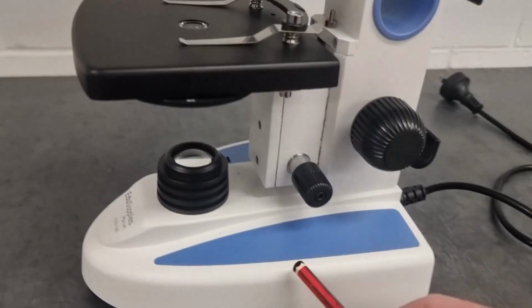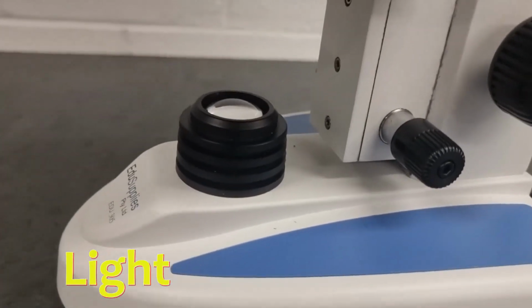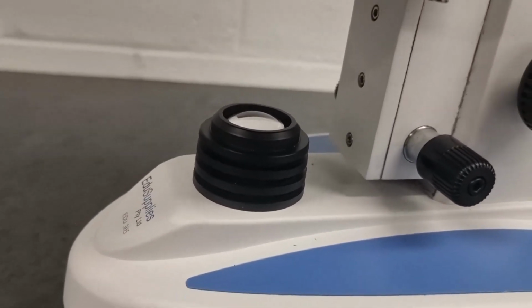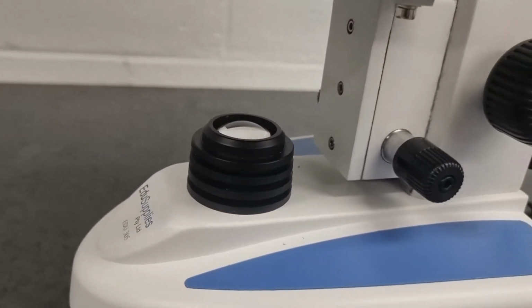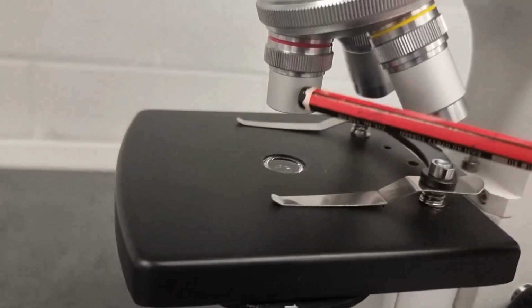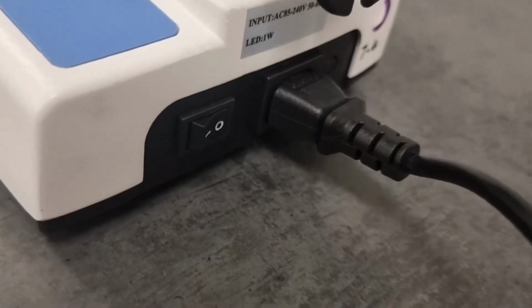So down near the base of the microscope here, the first thing we might notice is this right here. That's because these days we have technology, and what we do is we plug our microscopes in, we turn them on, and that is our light source. Now back in the day, instead of an electronic light source like this, we had a mirror, and we would just have to orientate the mirror towards the window to get the best light reflected up, because these are of course using light. The light comes up through this hole in the stage, through the lenses, up through the barrel and into our eyes. But like I say, these days we have a nice electronic light source there. The switch for this one is simply at the back of the microscope right there.